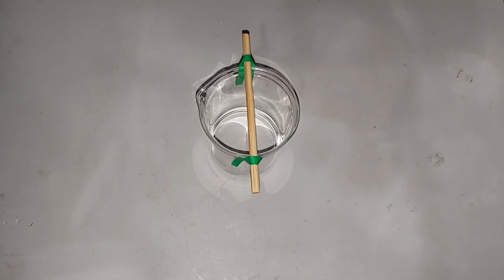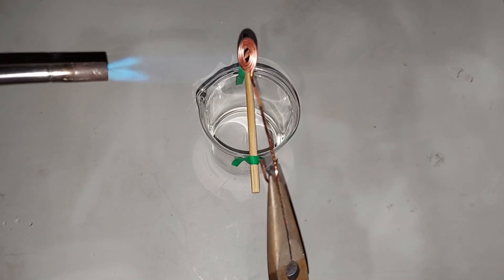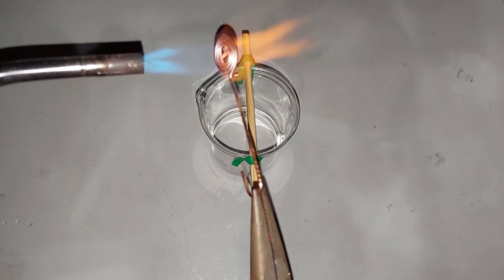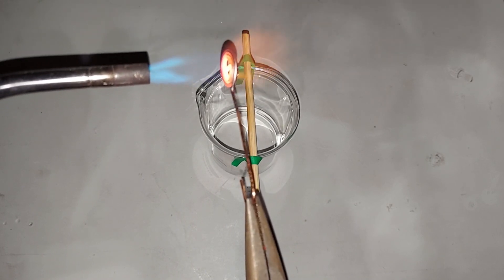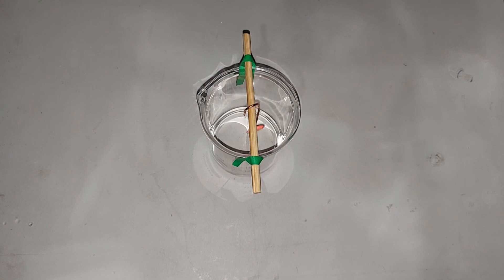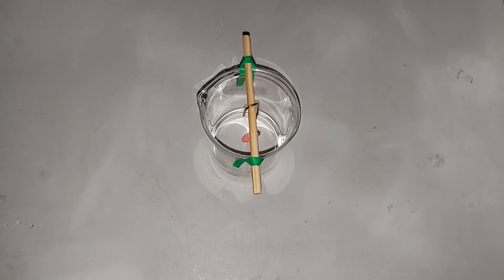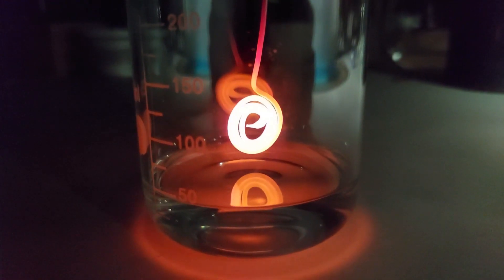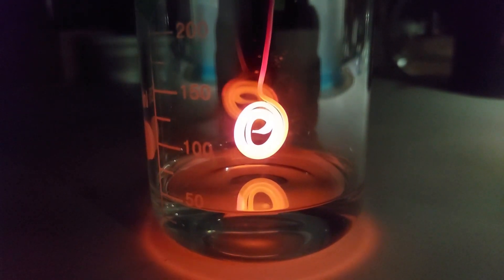We're going to heat the copper here - there's the coil we made. All right, it's getting red hot. You can see it's still glowing - we're going to turn the lights off. There we go. It's so bright - it's hard to believe that it's being heated by its own action. The oxidation of the acetone is so exothermic.